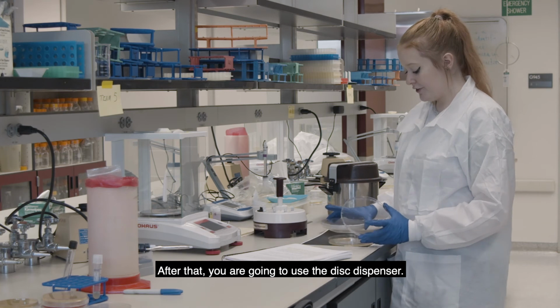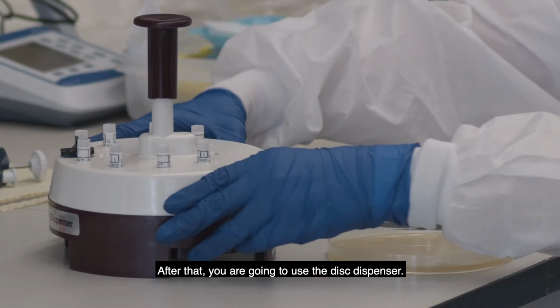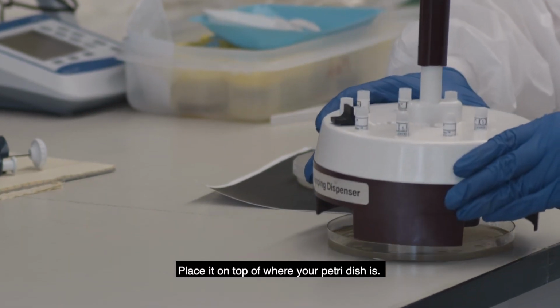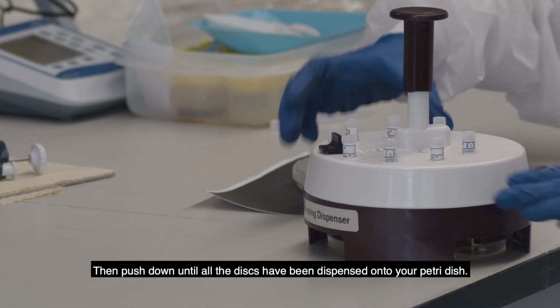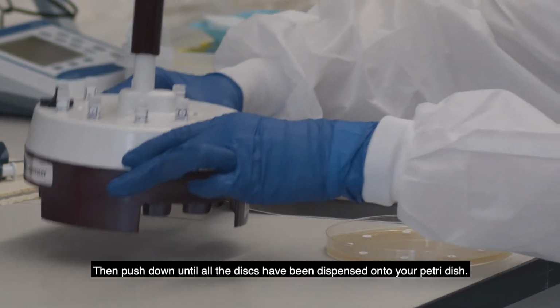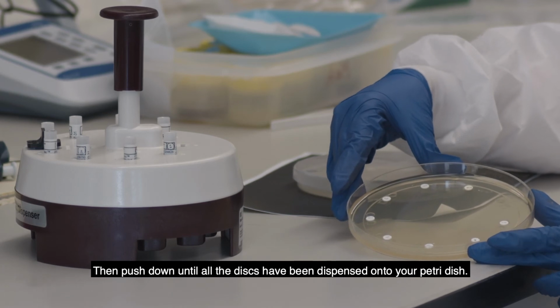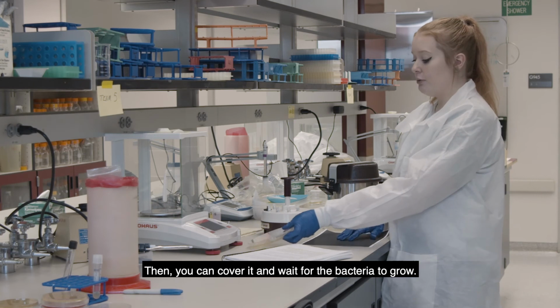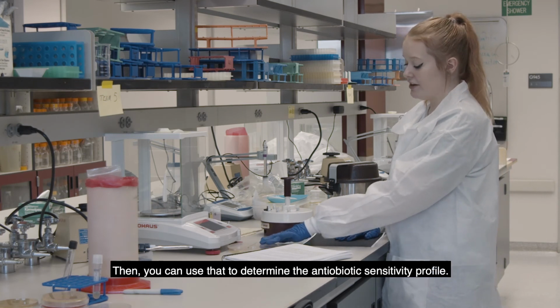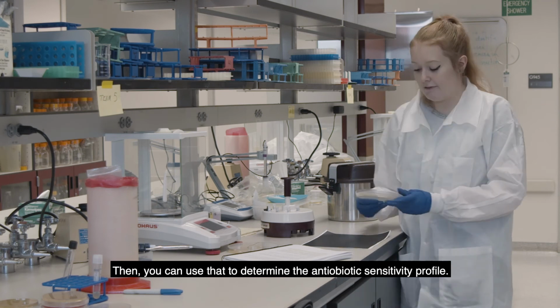Then after that, you're going to use the disc dispenser, and you're just going to place it on top of where your petri dish is and just push down until all the discs have been dispensed onto your petri dish. Then you can just cover it, and you're going to wait for the bacteria to grow, and then you can use that to determine the antibiotic sensitivity profile.